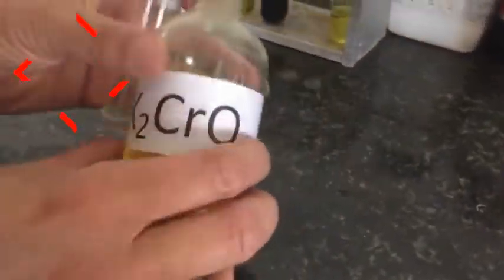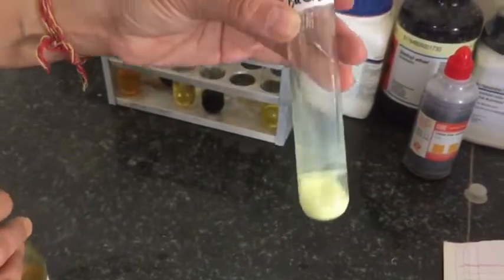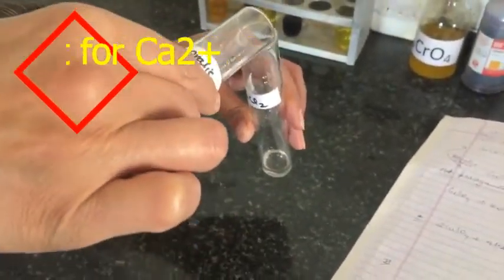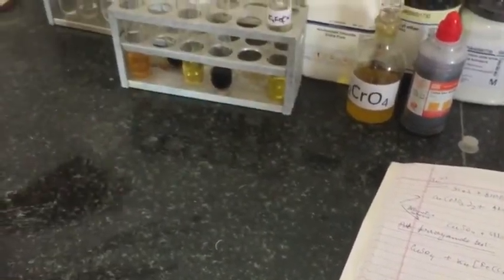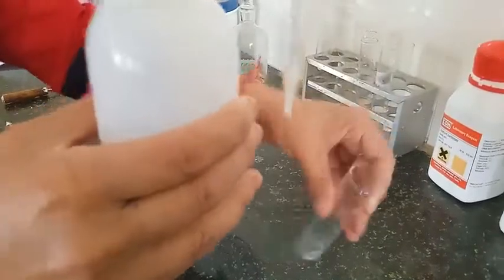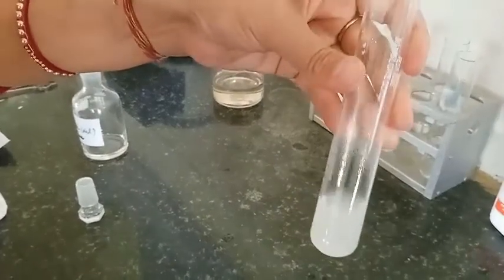Test for the fifth group, which contains barium, calcium, and strontium. For barium: adding potassium chromate solution to the original solution gives a yellow precipitate of barium chromate. For calcium chloride solution: adding oxalic acid gives a white precipitate of calcium oxalate. Here you can see calcium oxalate and barium chromate for comparison. For magnesium sulphate: adding ammonium hydrogen phosphate in the presence of ammonium hydroxide gives a white precipitate of magnesium phosphate.